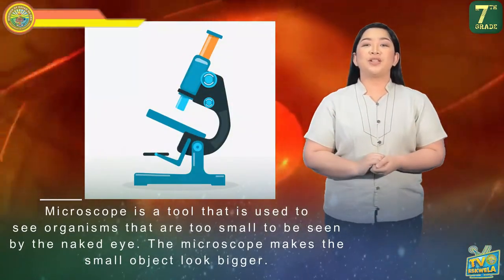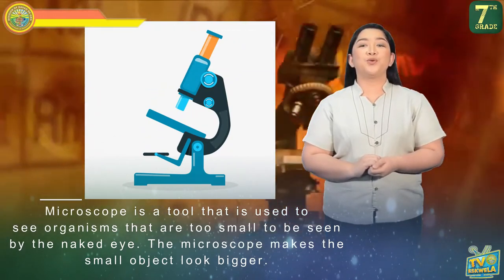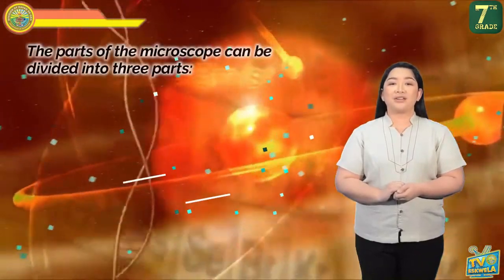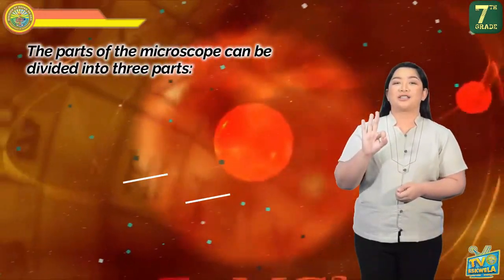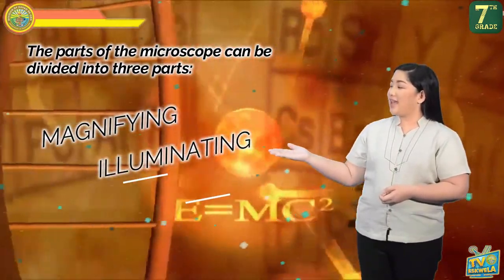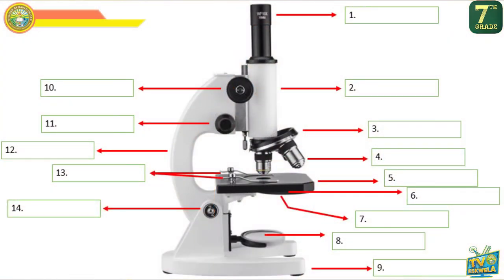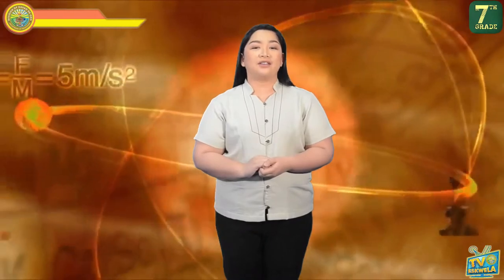Those are the different parts of a microscope and their specific functions. To sum it up, a microscope is a tool used to see organisms too small to be seen by the naked eye, and it makes small objects look bigger. The parts of the microscope are divided into three groups: magnifying, illuminating, and mechanical parts. Try to label the parts of a microscope on a sheet of paper and compare your answers to the answer key at the end of this video.